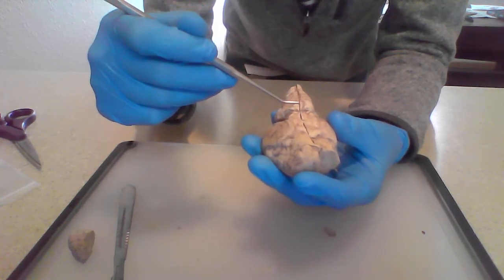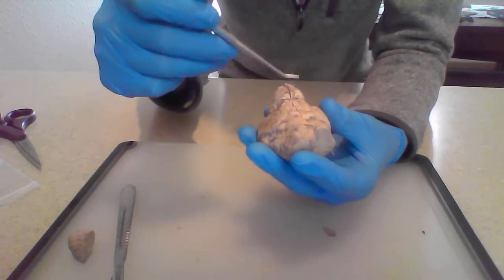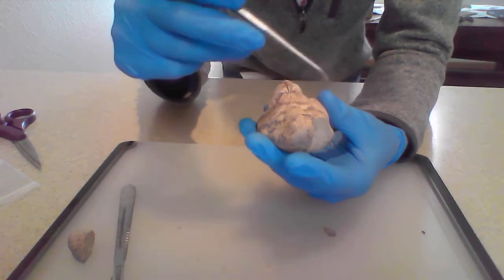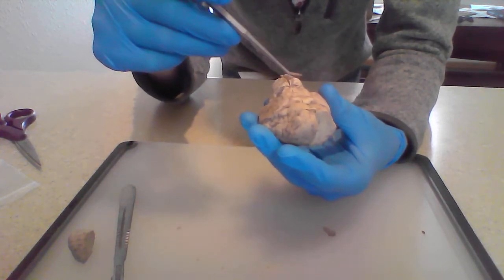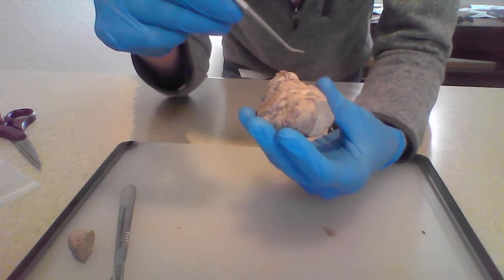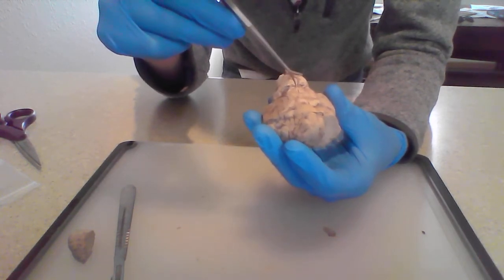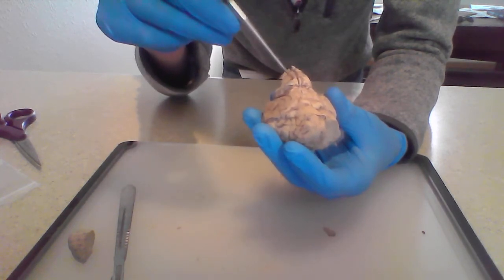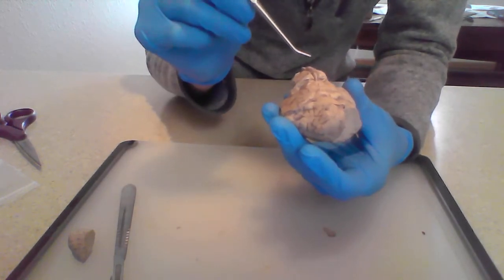And then we have the pons right here. It's that second bump, and that is largely in charge of communication through the cerebrum and the lower part of the brain through several groups of nerves, like the trigeminal nerve is in there, and there's another one that I just can't recall right now, but they're both through there. And other nerves as well. I think there's a series of 4 nerves that go through there.